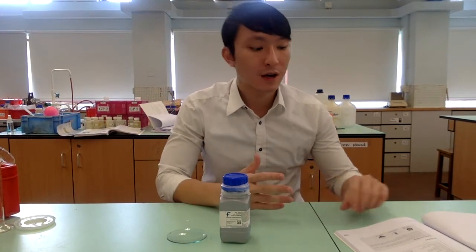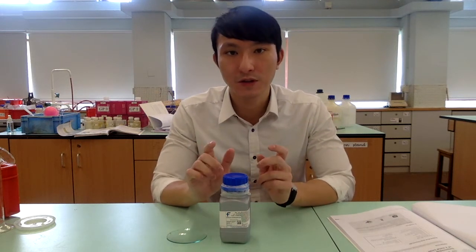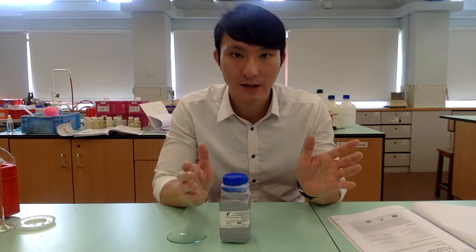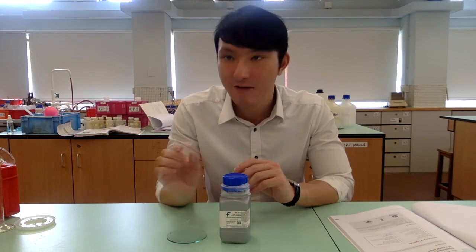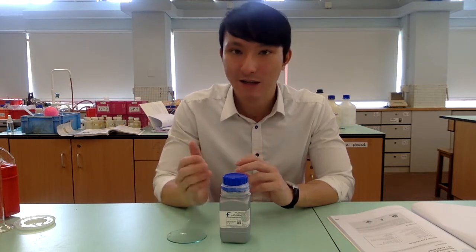Hi, in this video I'm going to show you experiment 35.1, the determination of enthalpy change of formation of calcium oxide. First of all, you need to know that in order to form calcium oxide we will have calcium reacting with oxygen. However, the direct reaction between calcium and oxygen is too vigorous and often it may form some side product such as calcium nitride. So a direct determination is not feasible. That's why in today's experiment we will go for an indirect method.